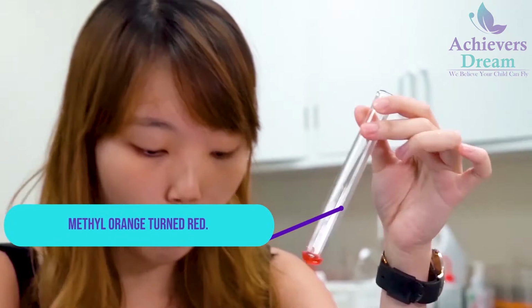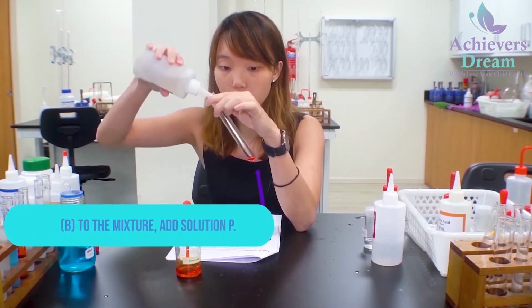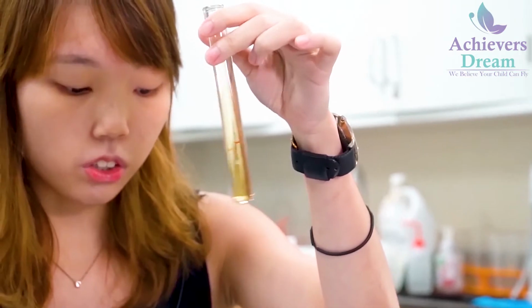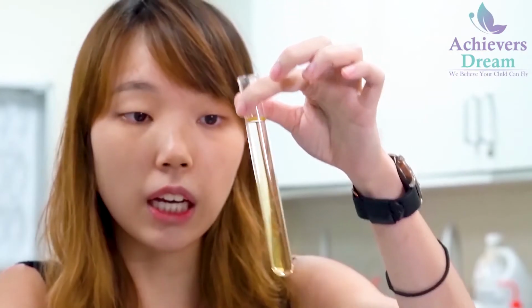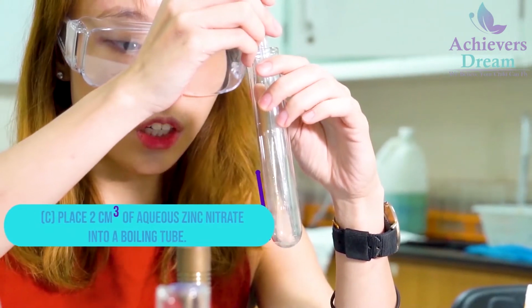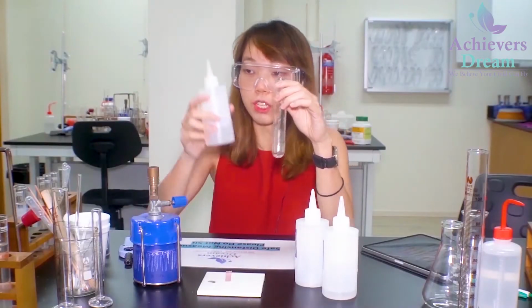Okay, then for part B, to this mixture, I'll be adding solution P until there's no further change observed. Okay, so after adding in your solution P, you notice that your methyl orange turned from the initial red color to yellow color. So for part C, I'll be placing 2 cm cube of zinc nitrate into a boiling tube, okay, followed by the addition of solution P.